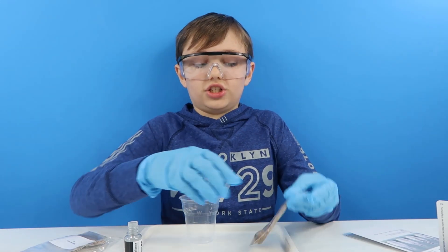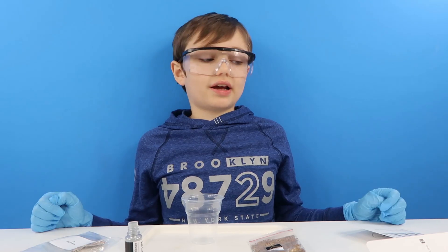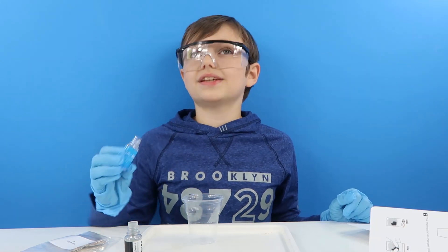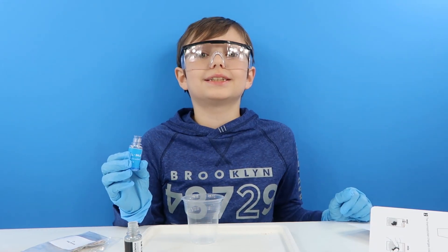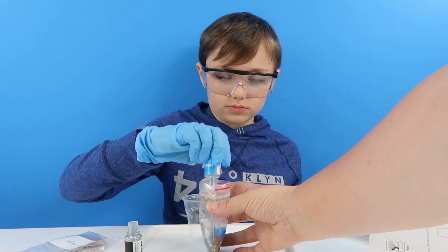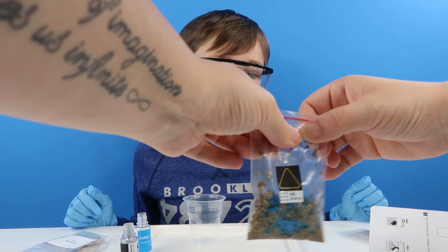So the thermosticker has actually changed colour — so about 50 degrees Celsius. Now I need to put a bottle of copper in there. Oh, this looks like the Christmas experiment we did in our last video, guys. We seal it and now we mix for two minutes.